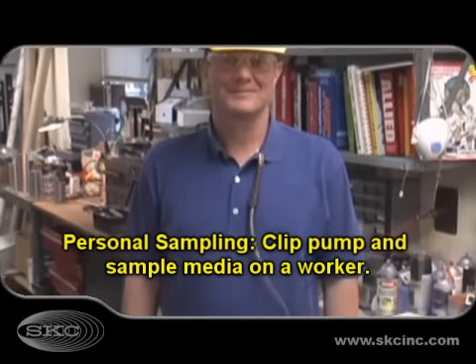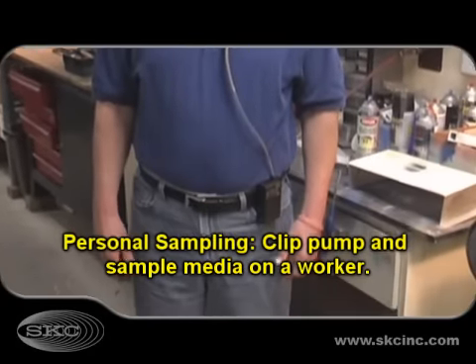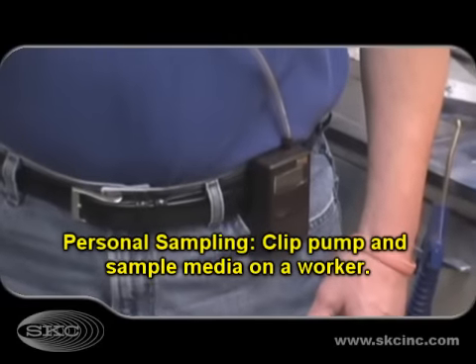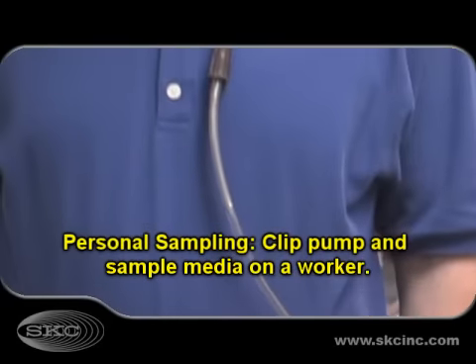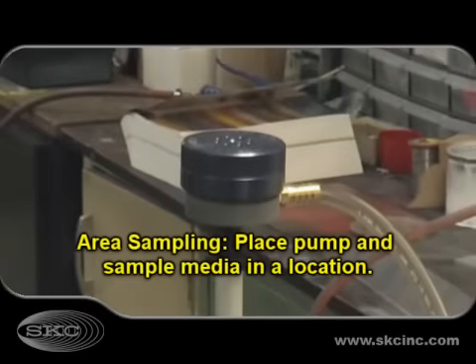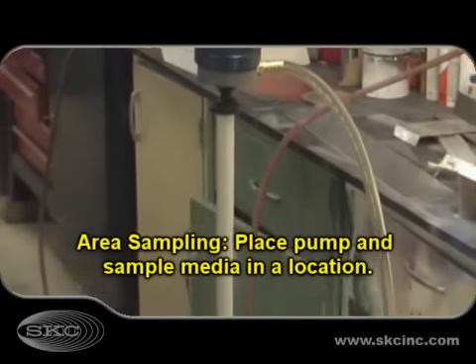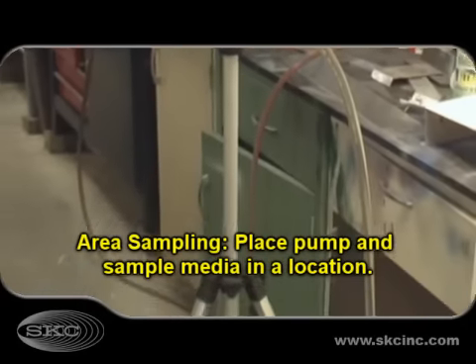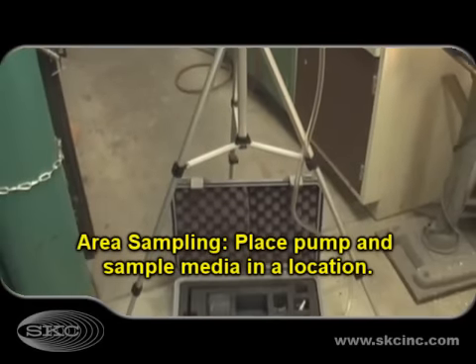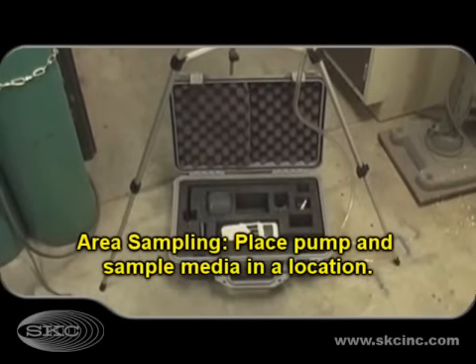Personal sampling is performed by placing the pump on the worker and the sample media in their breathing zone to measure individual exposure. Area sampling is performed by placing the pump and sample media in a specific location to determine concentration levels at a specific or fixed point.